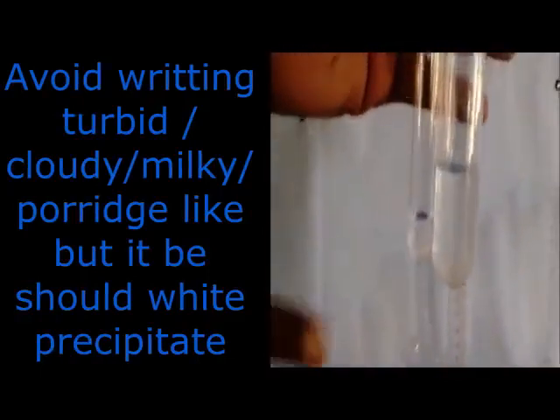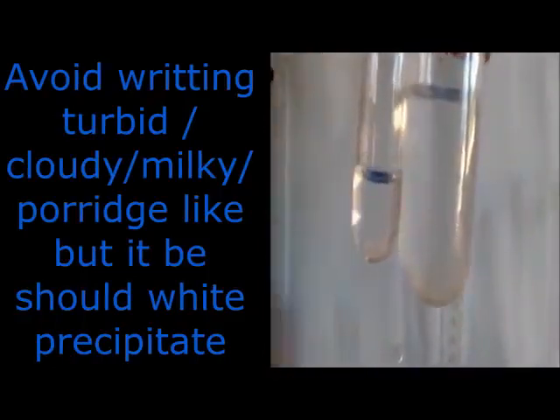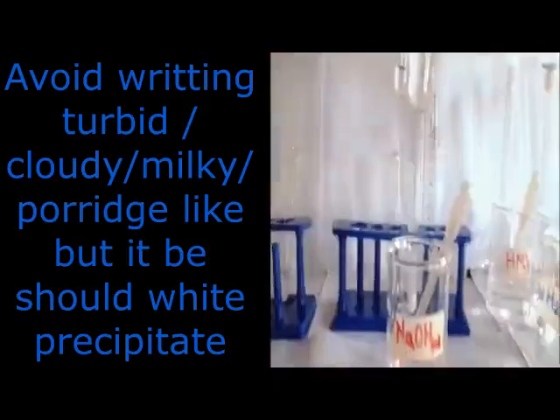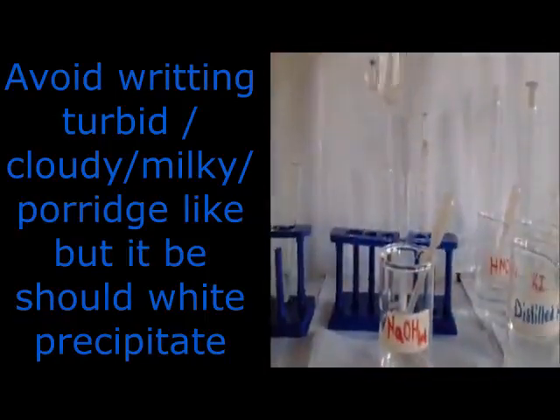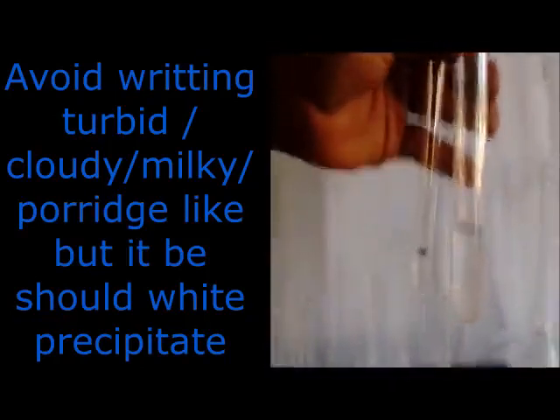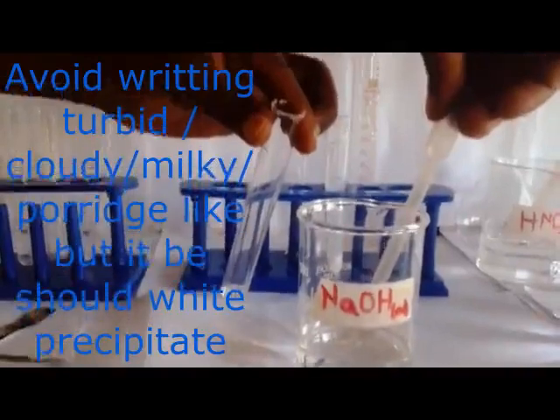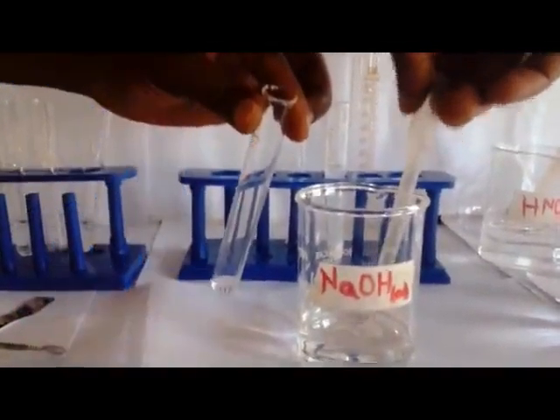I want to tell the teacher that the white precipitate is soluble in excess sodium hydroxide to form a colorless solution.